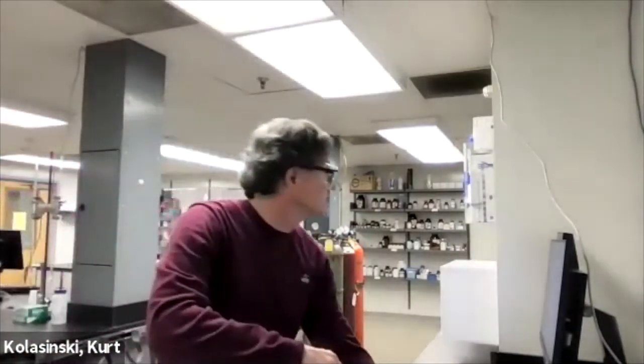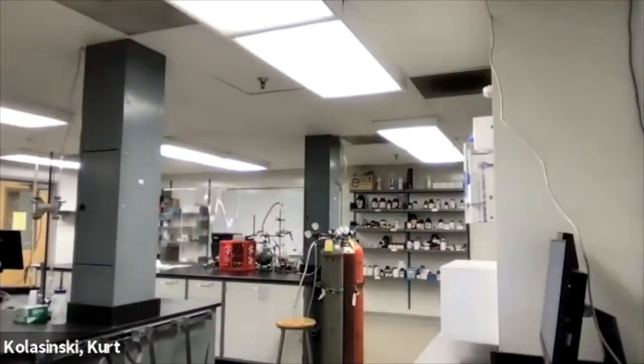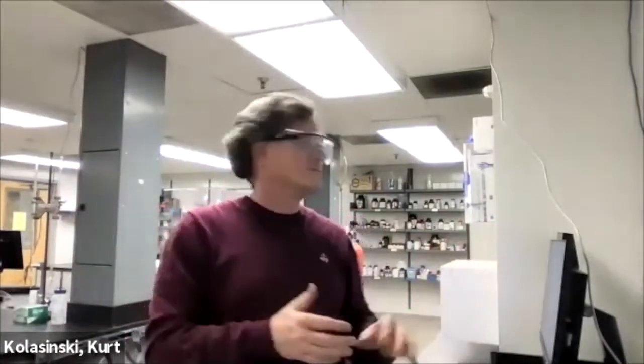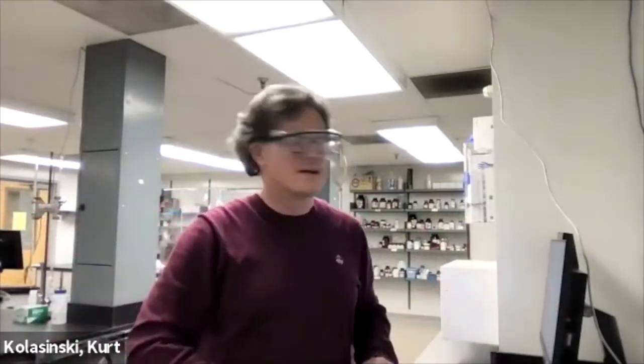And we'll run that for the zero. Here you just click on zero. It says you have a sample in there. Yes, you're right. There's like no signal there. It's a bunch of electronic noise. Maybe a little bit of scattered light or who knows what off of the cuvette itself. That kind of stuff. It's less than one count. We had over 800 counts of fluorescence. We've got less than a count of background. Forget it. So it's good, but it's going to subtract that anyway for us.